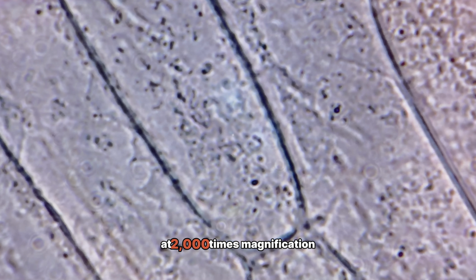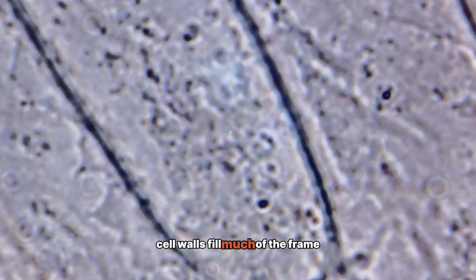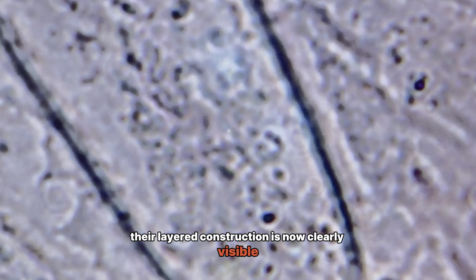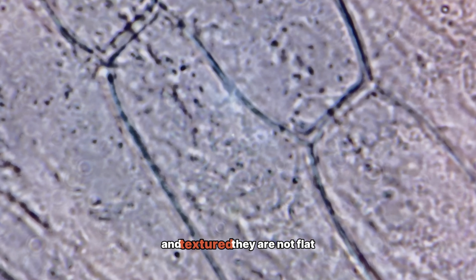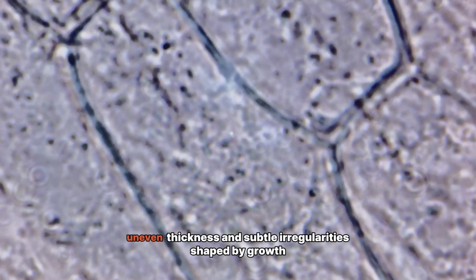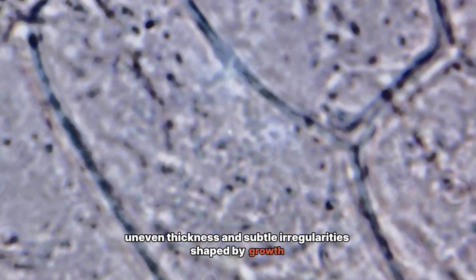At 2,000 times magnification, the onion becomes almost architectural. Cell walls fill much of the frame. Their layered construction is now clearly visible. The surfaces of the walls appear complex and textured. They are not flat. They show fine ridges, uneven thickness, and subtle irregularities shaped by growth.